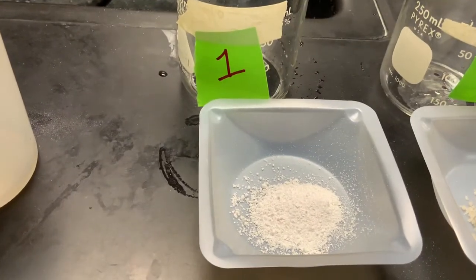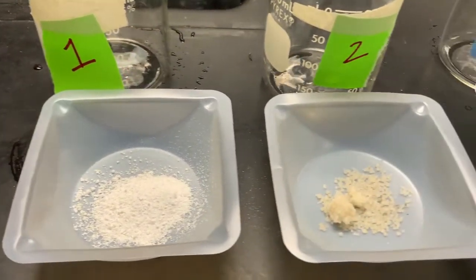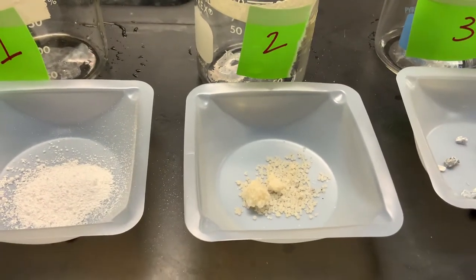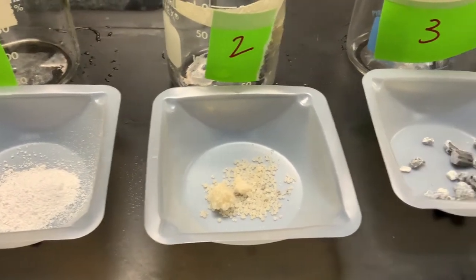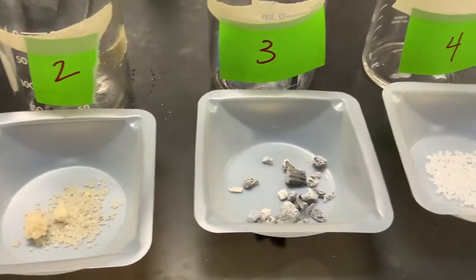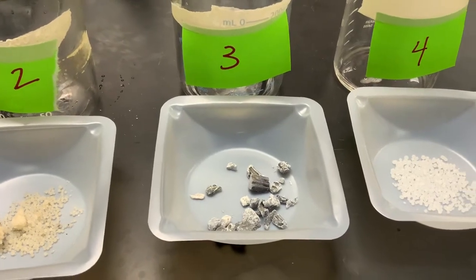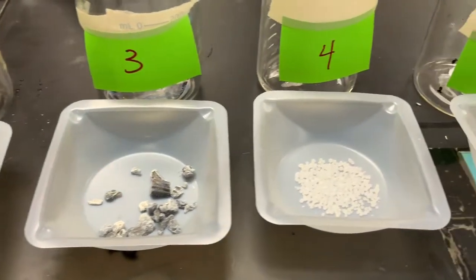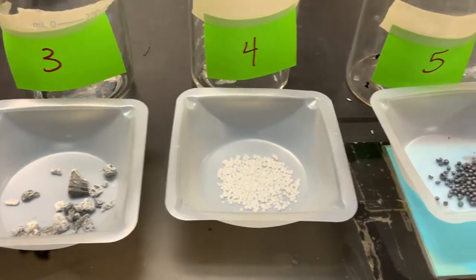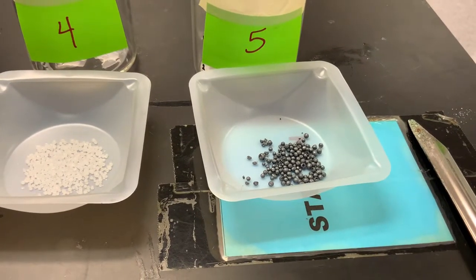Unknown one. Unknown two. Three. Four. And five.